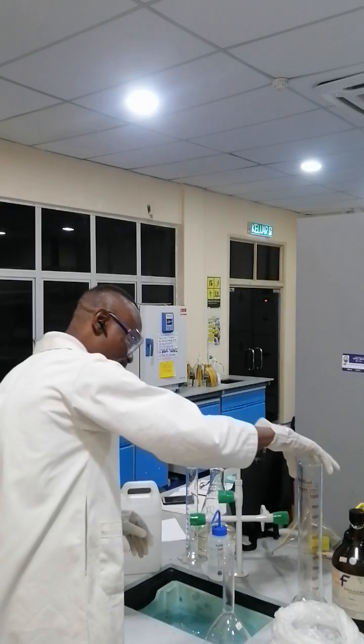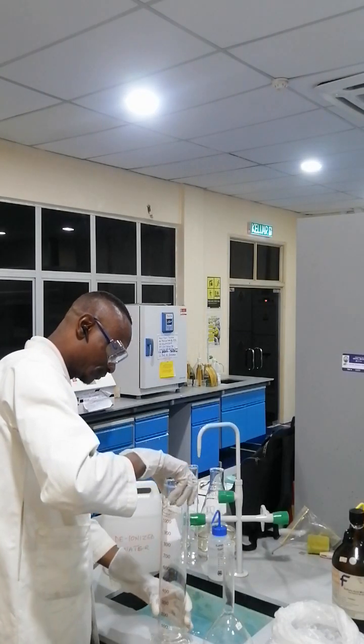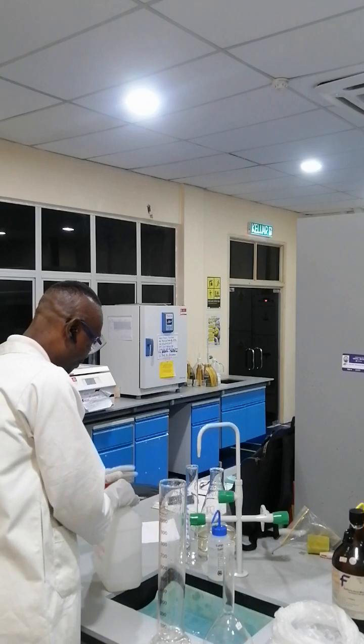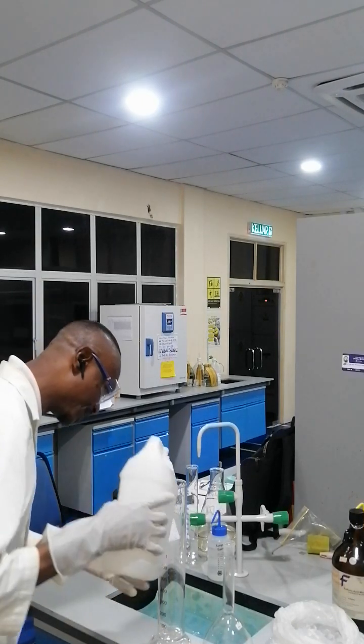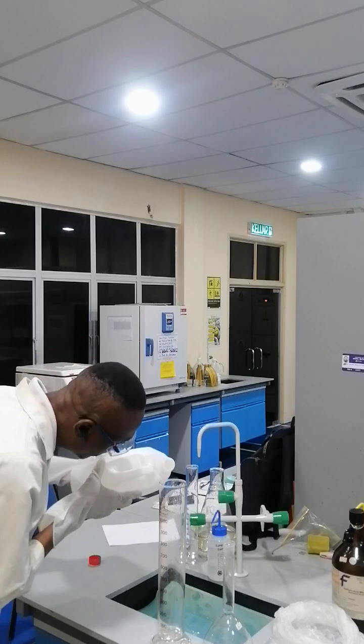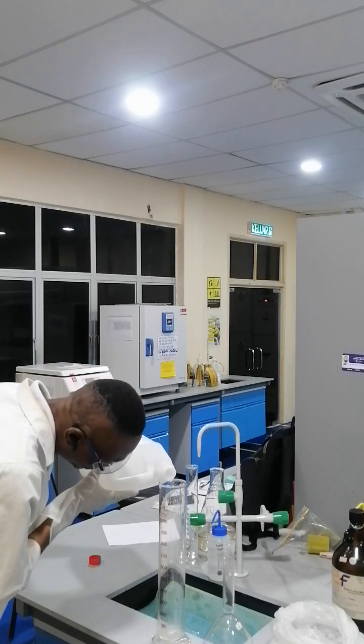So, first of all, we measure 250 ml of deionized water.